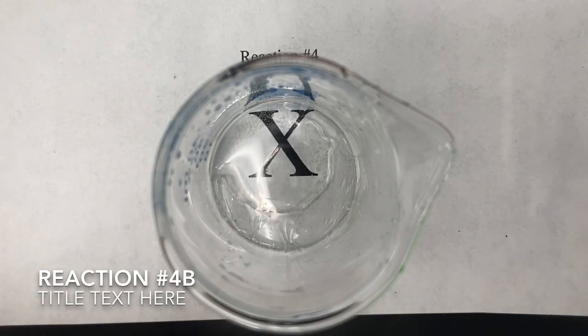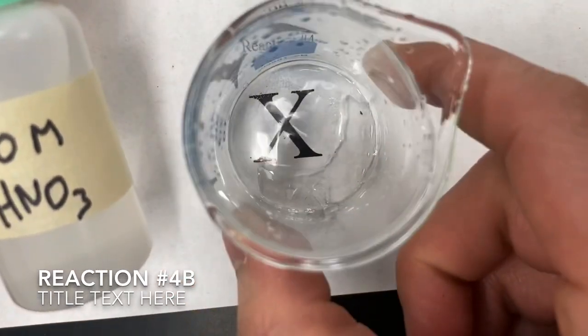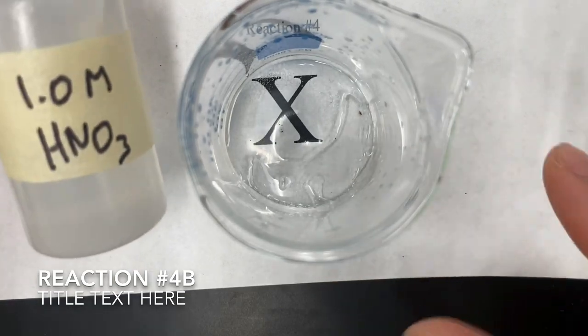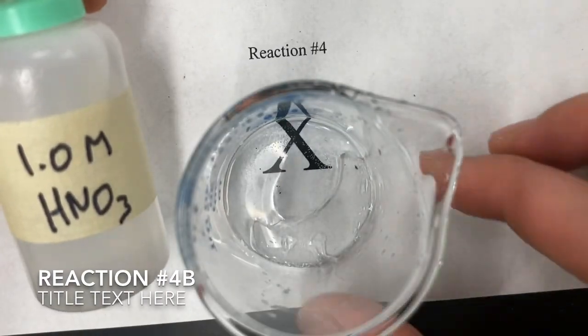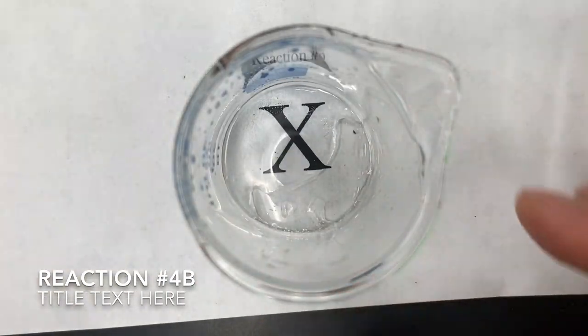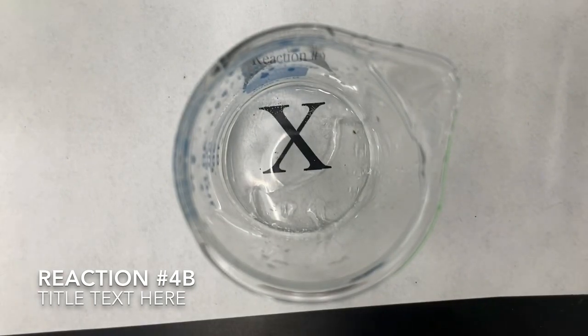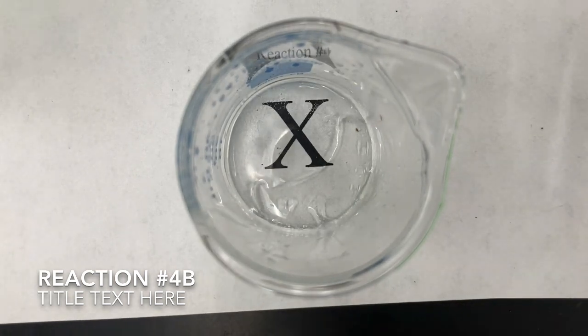All right, so I add more nitric acid, and as I do that, notice my precipitate actually disappears. Okay, I'm losing my precipitate. So which direction do you think equilibrium will shift if that happens? So make your final observation for the last part of the lab here. And make sure you answer those conclusion questions to wrap up this lab.